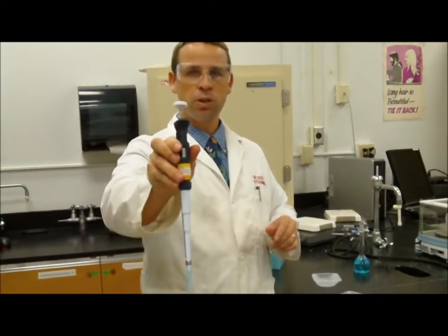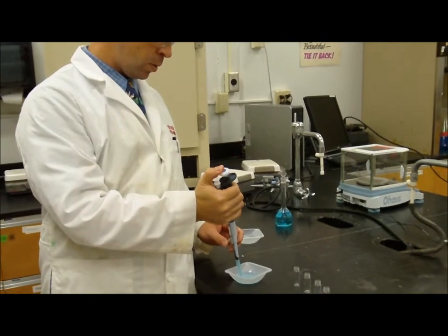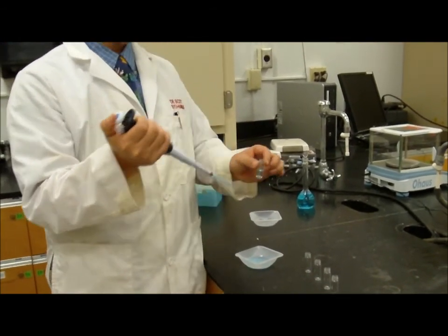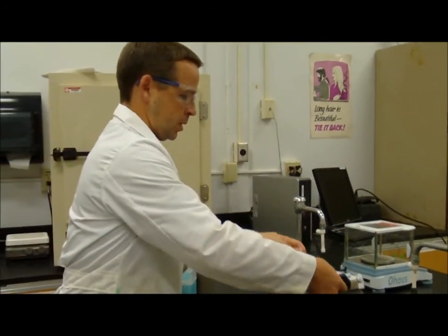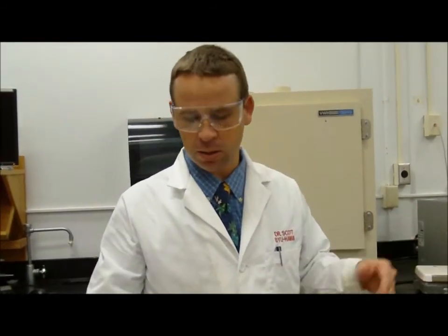All right, so right now it's set to 1 milliliter. So I can transfer 1 milliliter. I'll do 2 milliliters there so we can see it, right? Okay, so now I have 2 milliliters. Maybe if I put it over here on this white surface, we'll be able to see a little bit. So I have 2 milliliters of copper sulfate solution. This is the same copper sulfate solution that we made earlier, so it's actually 0.1 molar, right? But for us, we'll call that 100% copper sulfate solution, as if it's 100% ethanol or something like that.